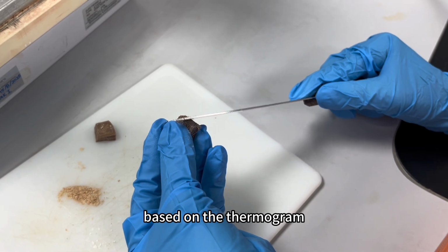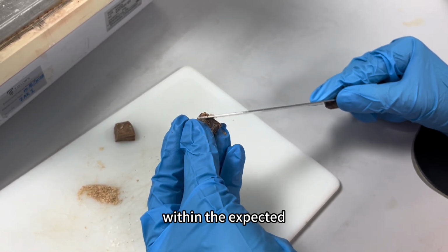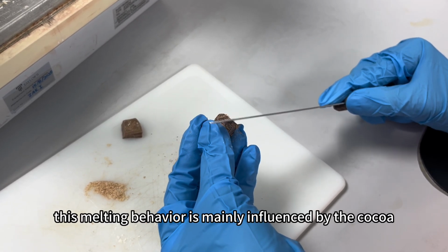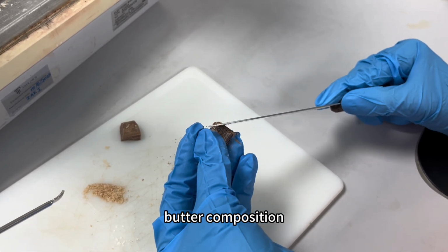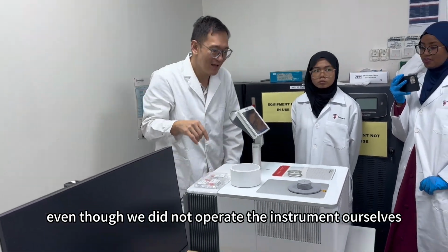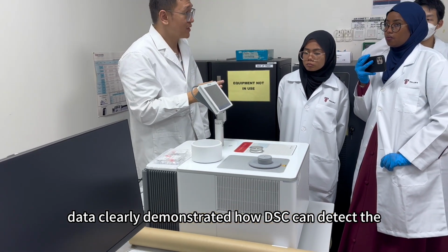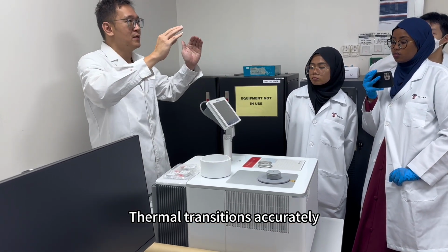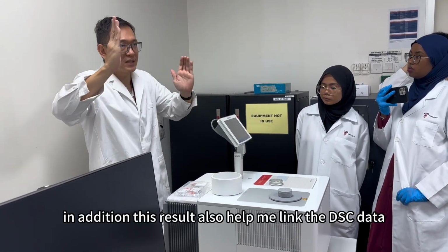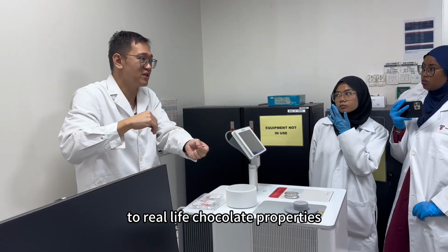Based on the thermogram, the chocolate shows a clear melting transition within the expected temperature range. This melting behavior is mainly influenced by the cocoa butter composition in chocolate. Even though we did not operate the instrument ourselves, the provided data clearly demonstrated how DSC can detect thermal transitions accurately. In addition, this result also helped me link the DSC data to real-life chocolate properties.